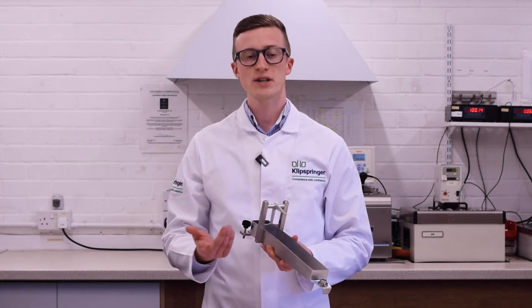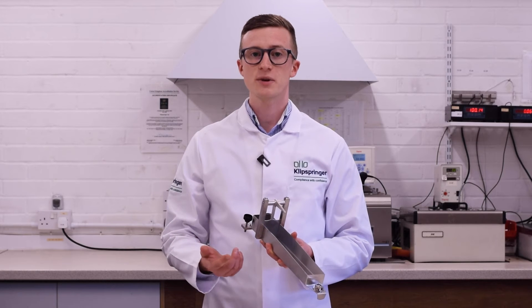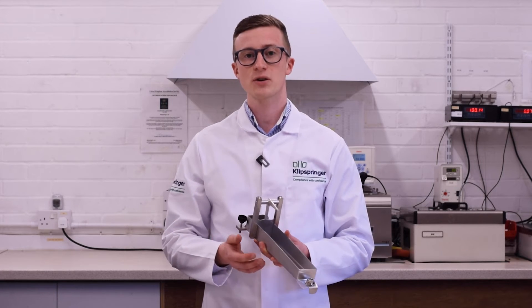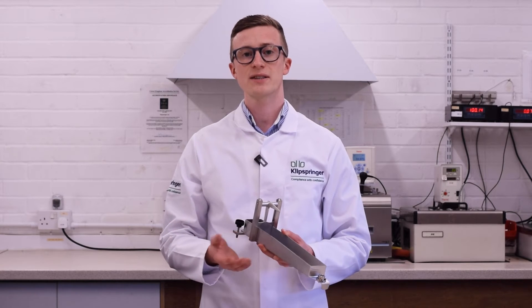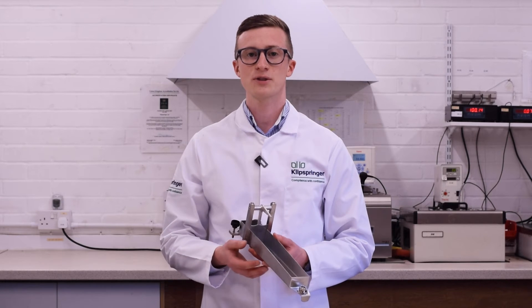The consistometer is available in 3 sizes: 24cm which I have here, 30cm and 50cm, ensuring you have the correct size for the viscosity of the products you are testing. In this video we'll take you through how to correctly set up and use your consistometer for consistent and accurate results.